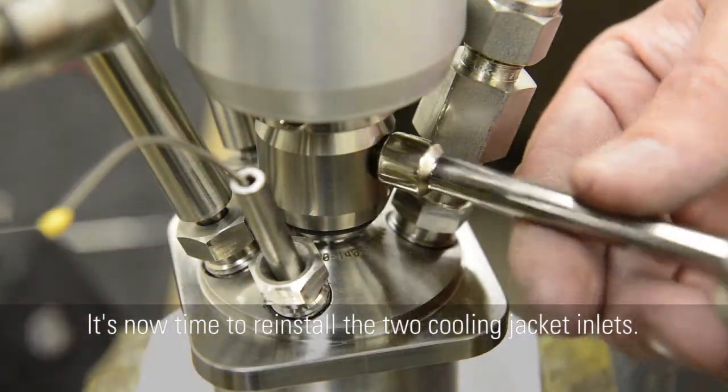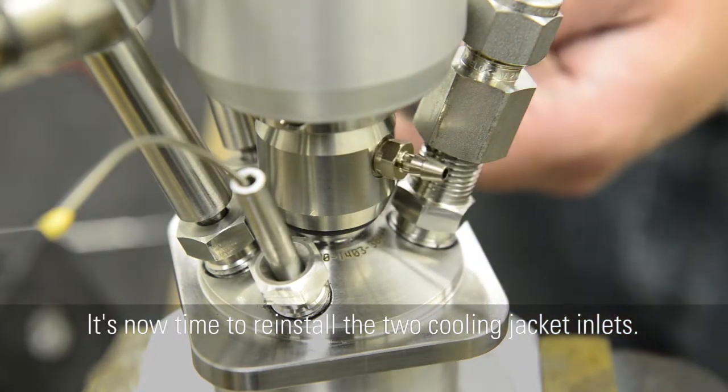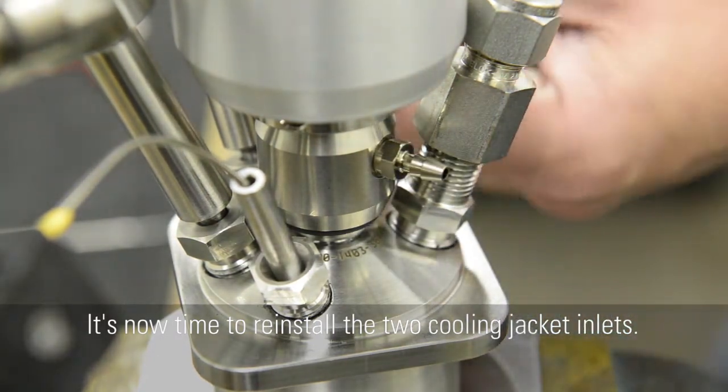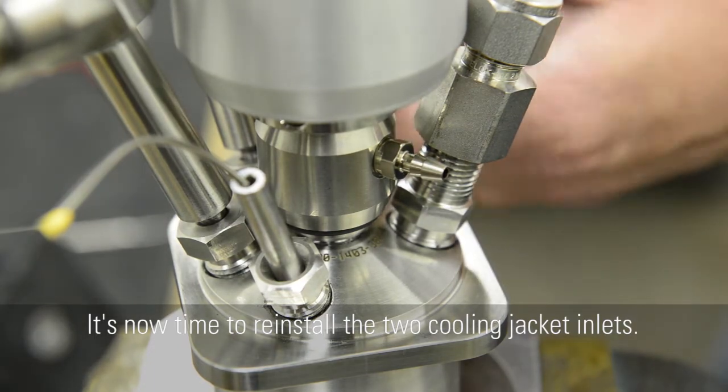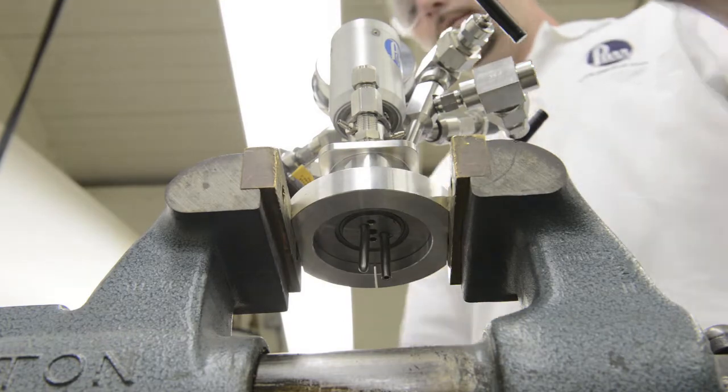It's now time to reinstall the 2 cooling jacket inlets. And finally, reinstall the stirring shaft.